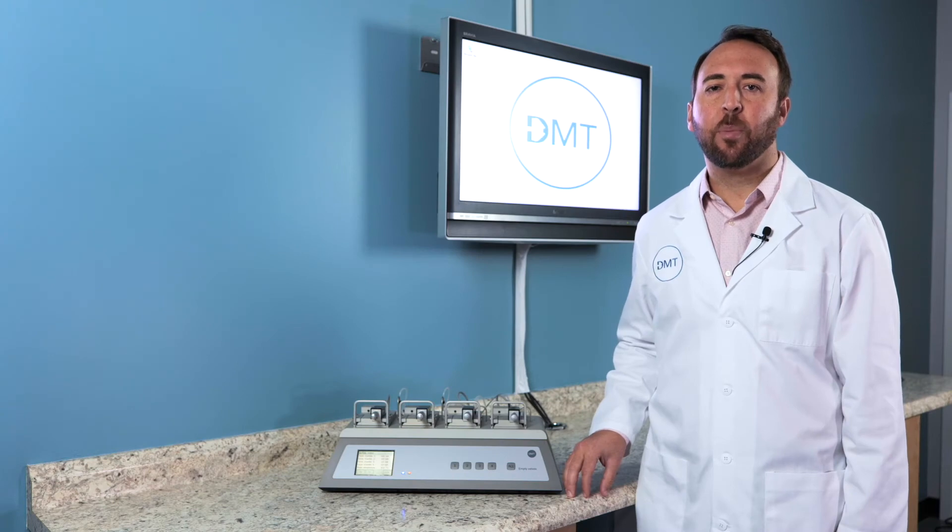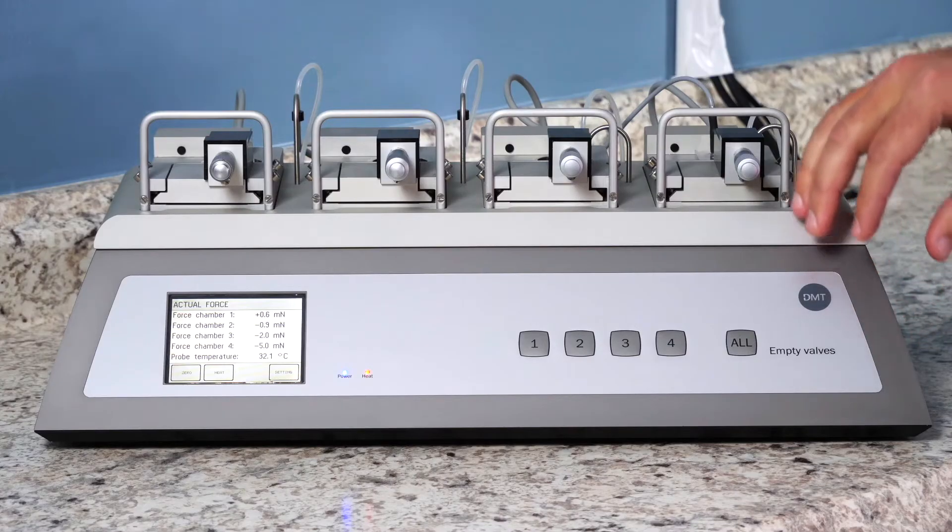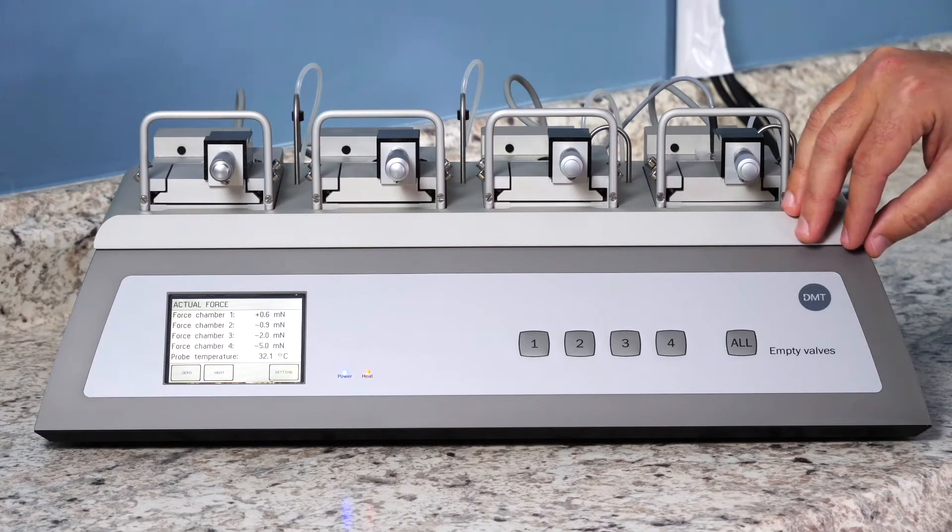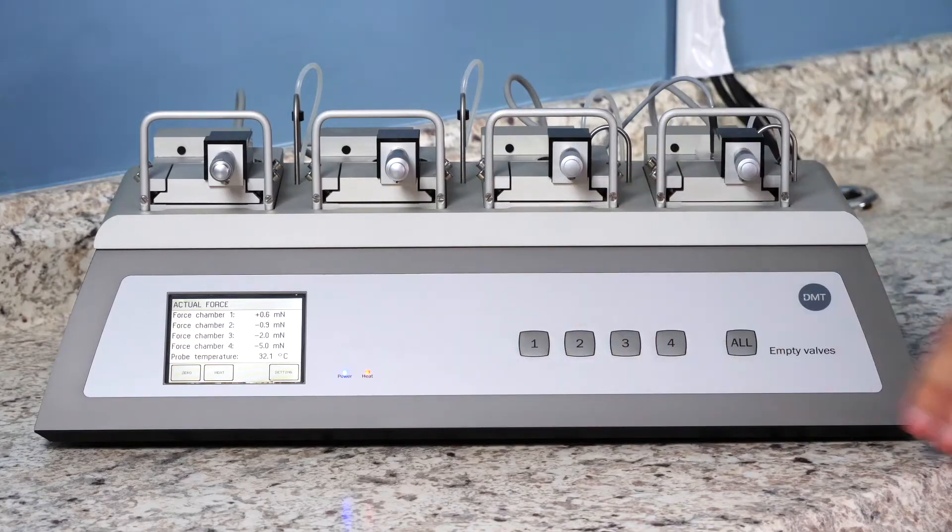In this video we're going to show the proper technique for force calibration of the DMT Myograph system. You will want your setup to be as close to experimental conditions as possible. Therefore you will need your heat turned on and the temperature to be at your experimental conditions.